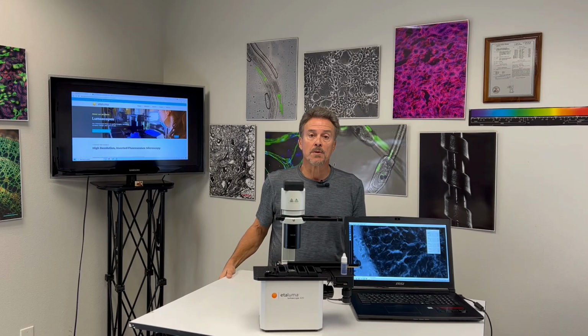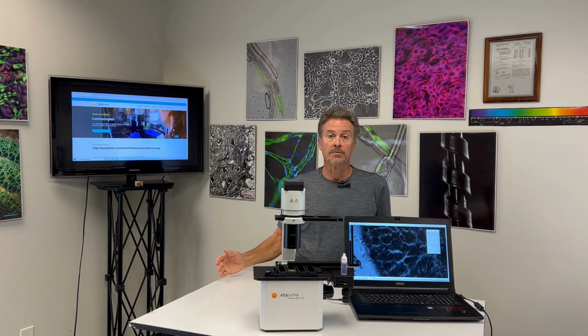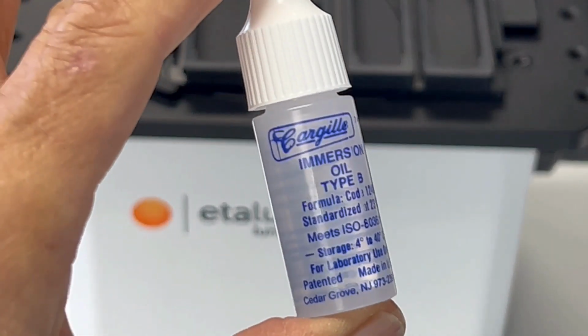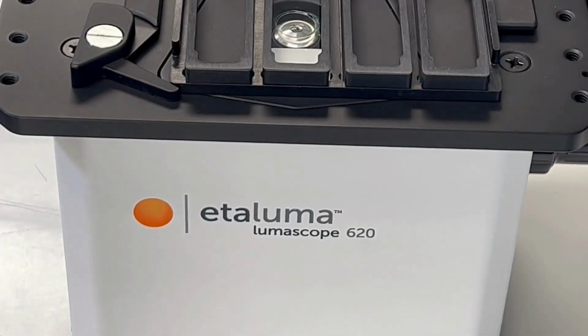We often get questions about the use of oil immersion objectives. Oil is used like a refractive index matching light pipe for high magnification microscopy, usually 60x, 63x, or 100x. There are different grades of oil depending on the use of fluorescence, including a type N for live cell imaging.